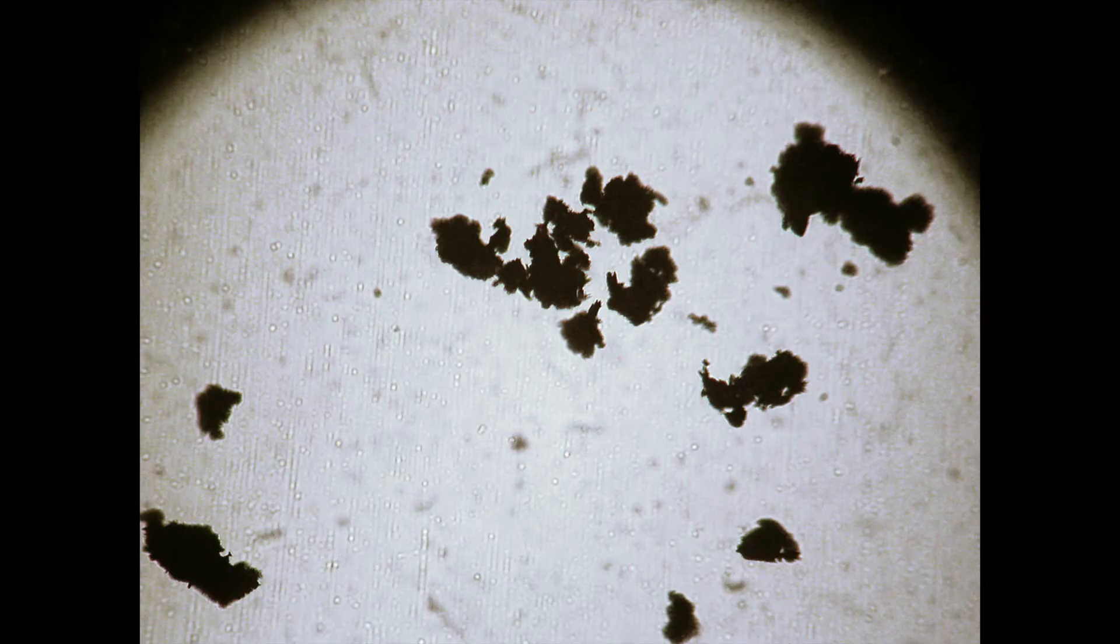To do this, you need something on a slide to look at using the 10x objective. If you don't have a prepared slide, use a new one and make a mark on it using either a permanent marker or a pencil. Just make sure you can see the mark with the naked eye for positioning purposes.